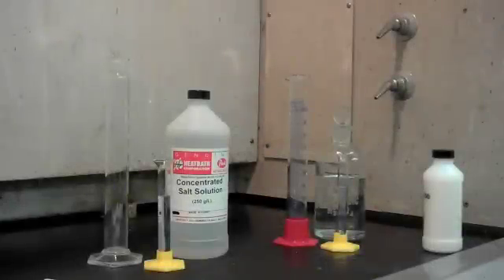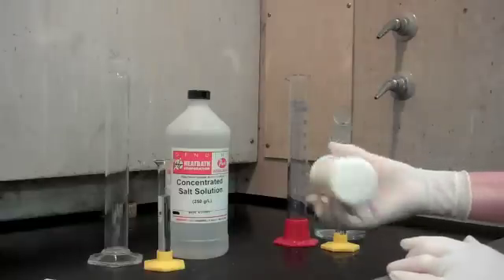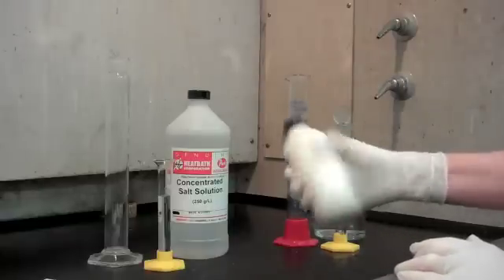In this video, I want to show how we determine the concentration of an emulsifiable oil bath. The first thing you want to do is, with your sample, mix it very well so that you make sure it's even throughout.